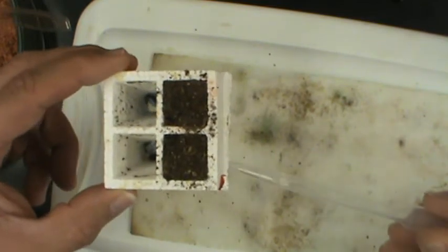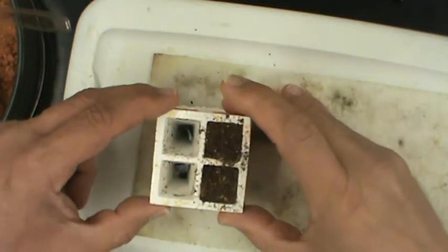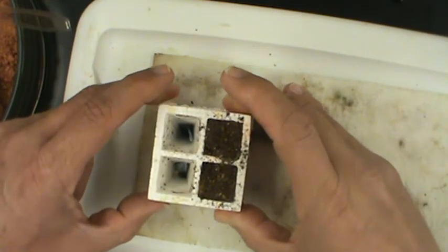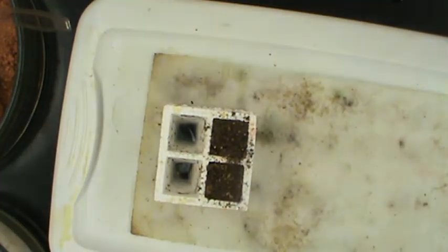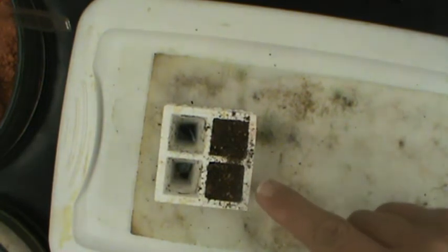Then, when we have a continuous stream of water, you set this quad down onto this wet felt. That way, water will be transported all the way up and keep a steady supply of water to your germinating seeds and plants.